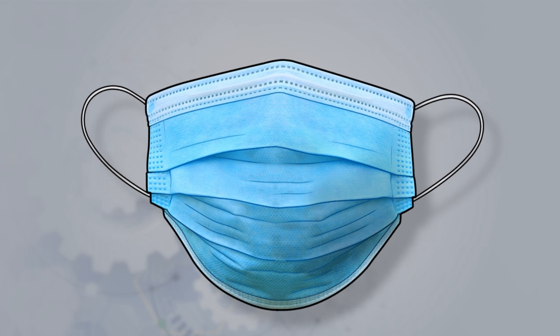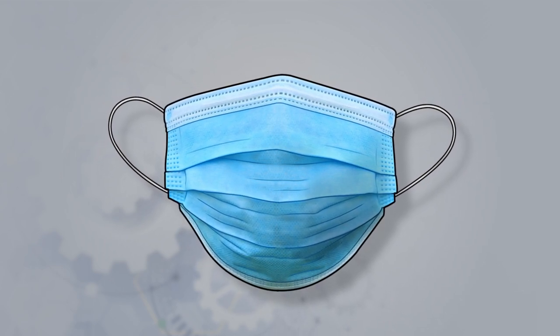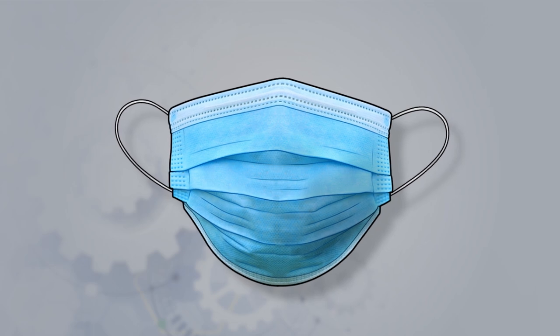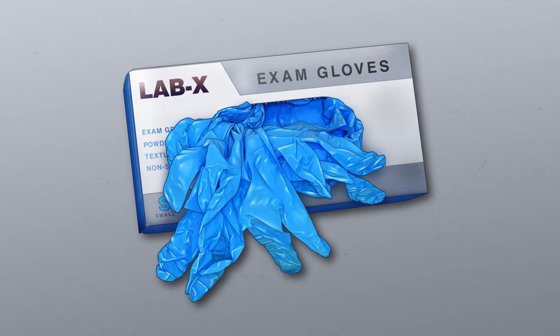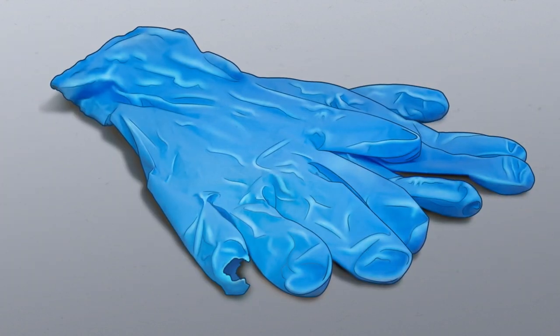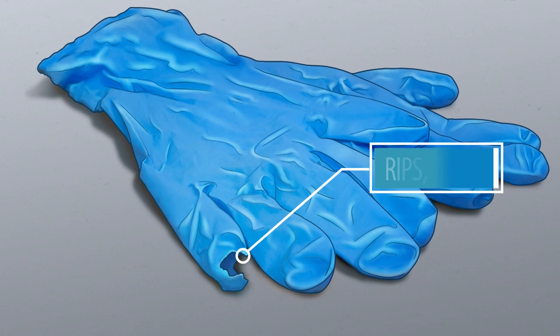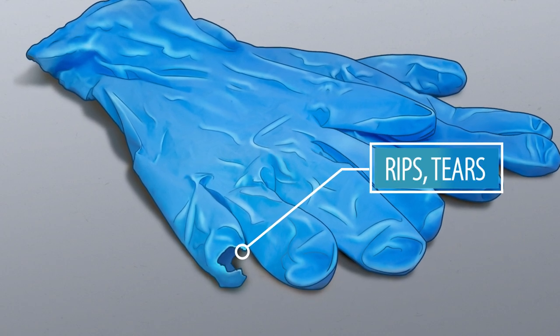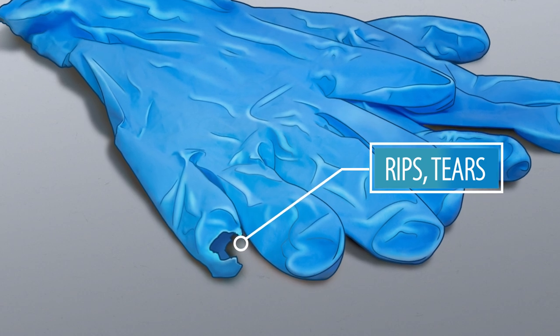Please note, this scenario will demonstrate donning and doffing a disposable face mask. Make sure you have the right size gown and gloves, and don't forget to visually inspect all of your PPE for rips, tears, loose or missing straps, and replace any defective PPE you do find.